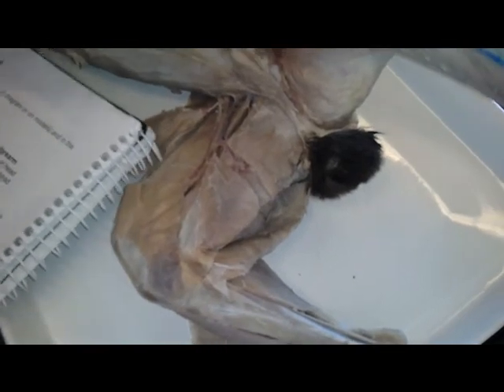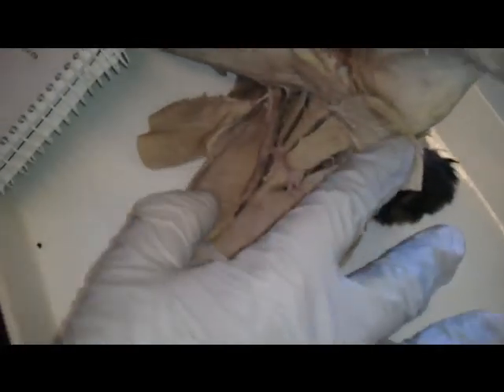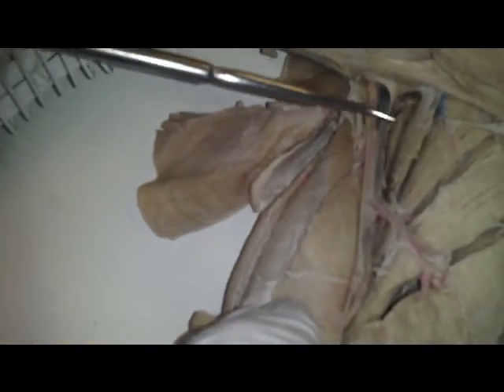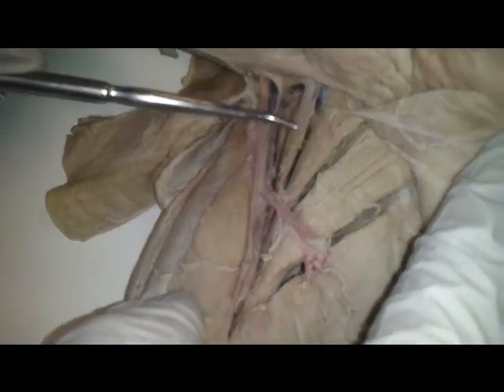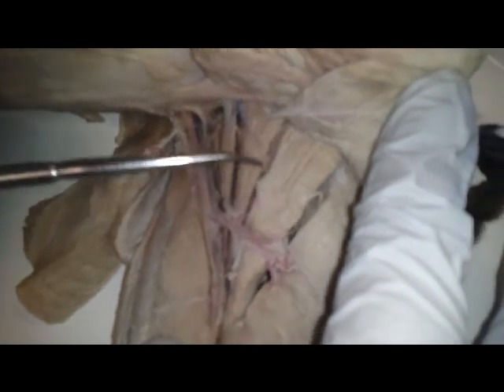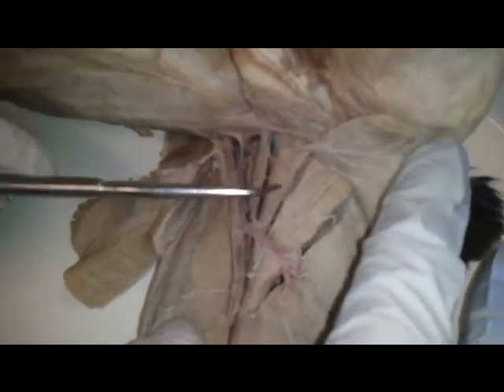For the medial thigh compartment, we have the gracilis, which is the superficial muscle that's like the sheet. Deep to that, we have 3 other muscles. We have the top, a little muscle in here called the pectineus. Below that, we have the adductor longus, and down here we have the adductor femoris, which is homologous to the adductor magnus in the human.